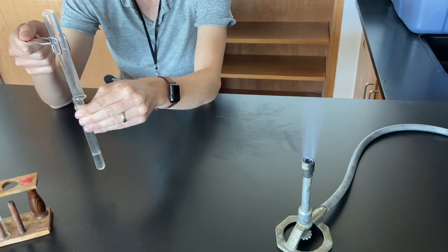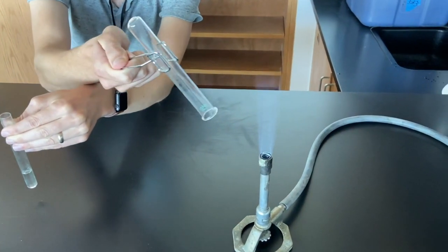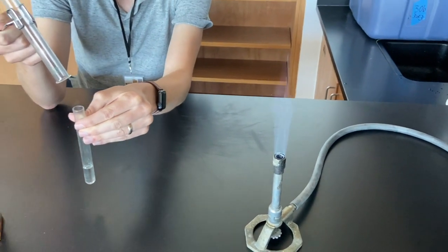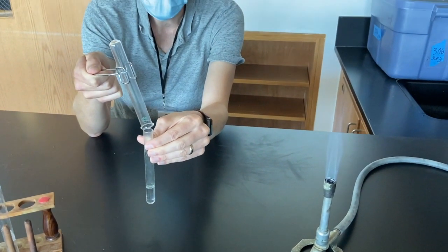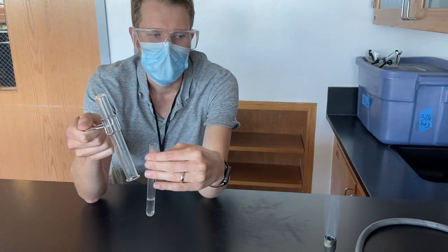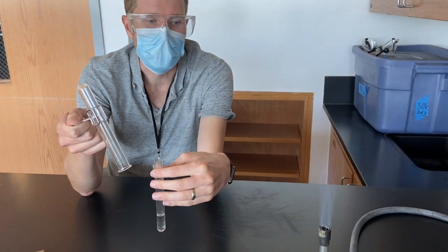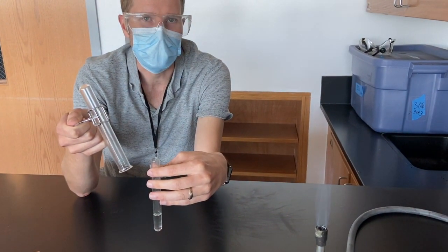There we go. Hopefully you were able to catch that. You want to describe in your after observations what you saw, what you heard, and then from there try and identify the type of reaction that you see.